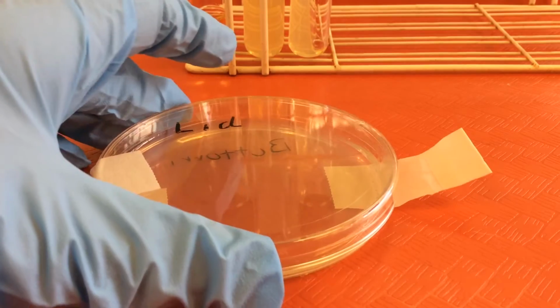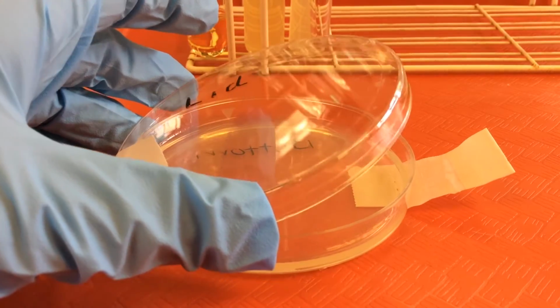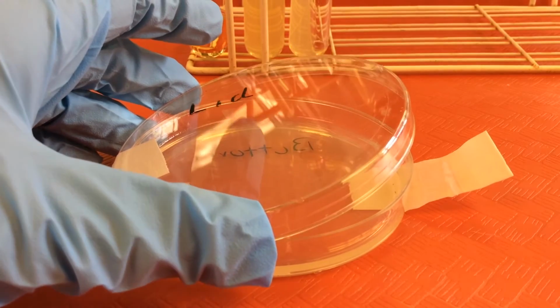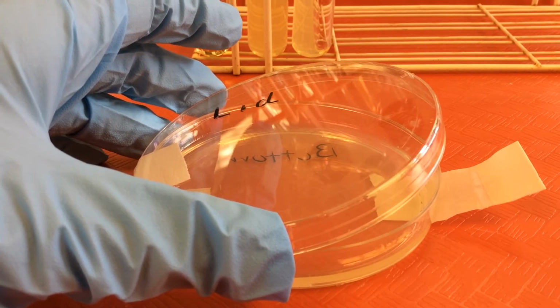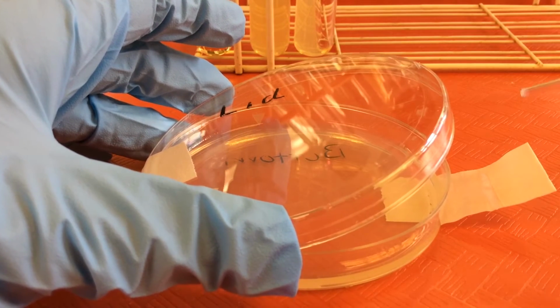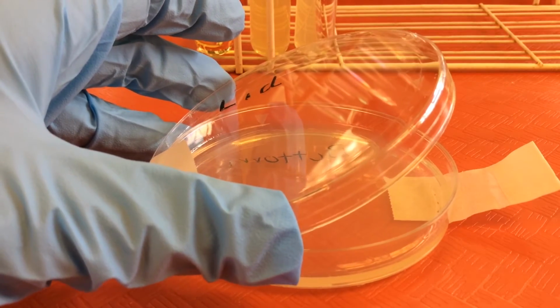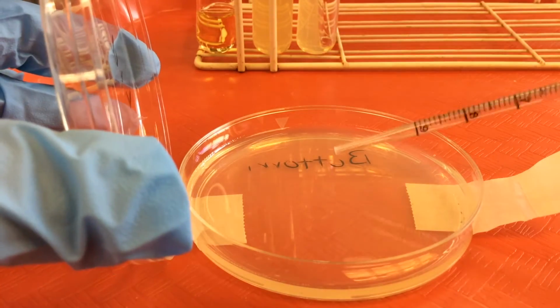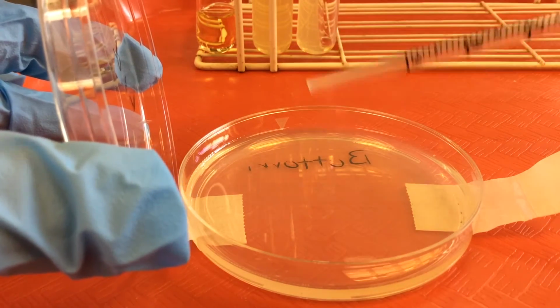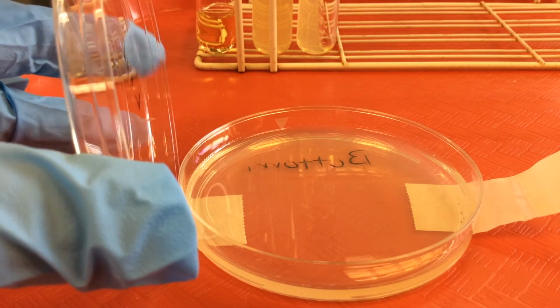Right? So when we want to open our plate, we always open them like a clamshell, like so. We never want to take the lid all the way off. The reason for this is that we're going to discover there are lots of microbes even in the air, floating in the air, maybe associated with dust particles. We always want to try to prevent unwanted environmental microbes from growing in our media. So if we took the lid all the way off, we would have lots of microbes that would just fall from the air onto the surface of the plate, thus contaminating our plate. We don't want to have contamination.